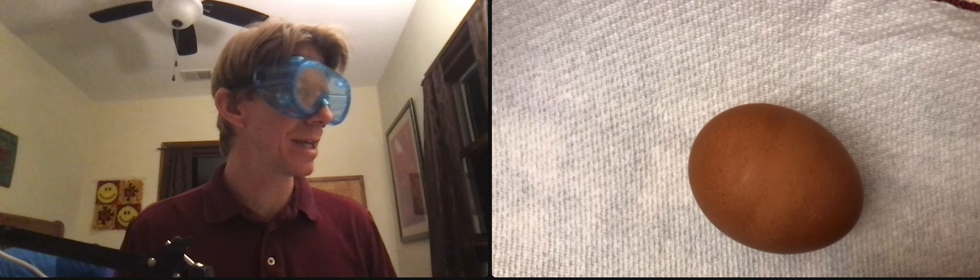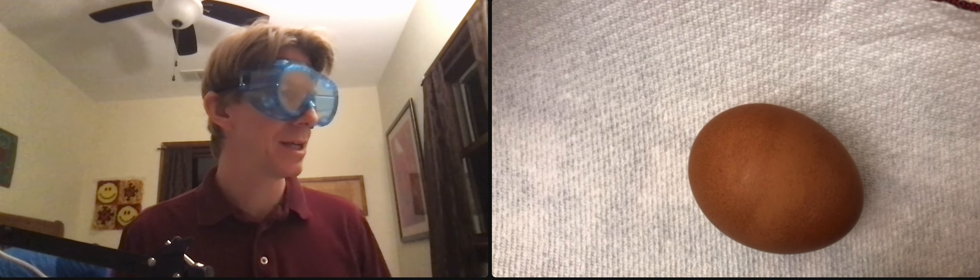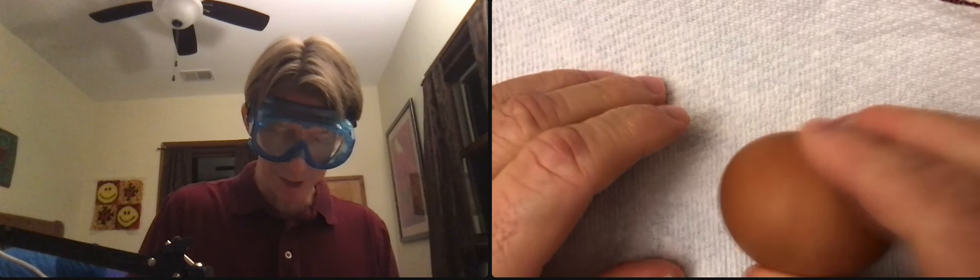Peel the shell off of the egg and keep all of the shell. Place the shell onto a paper towel or other piece of paper. Break into small pieces - there's an extra word in my copy right now but there won't be.